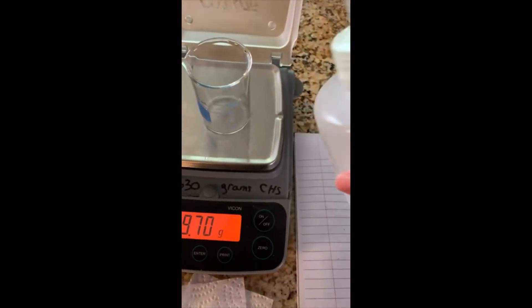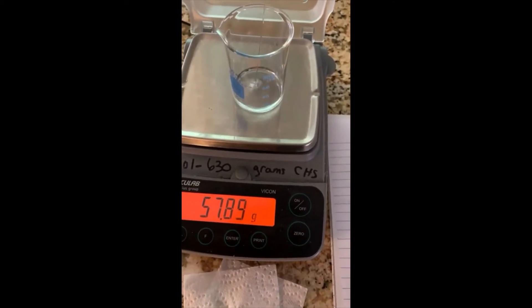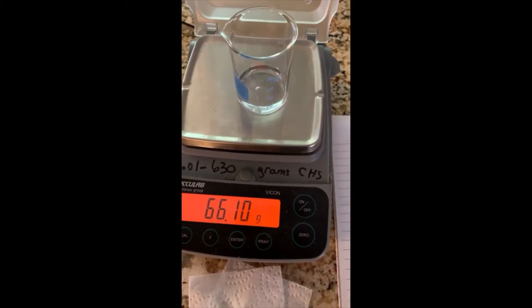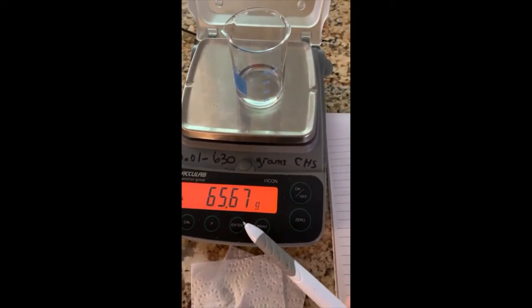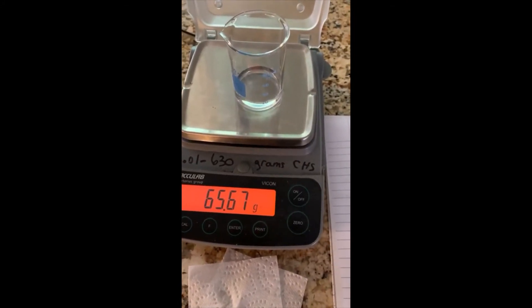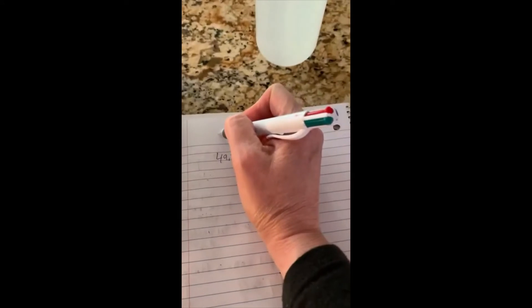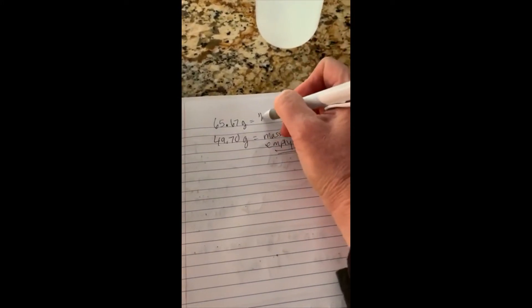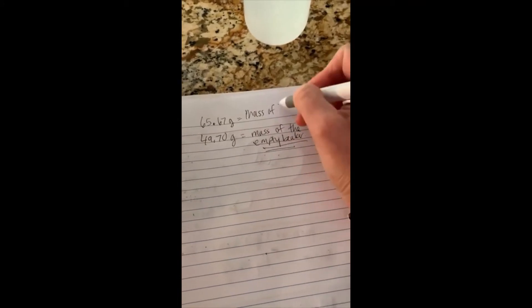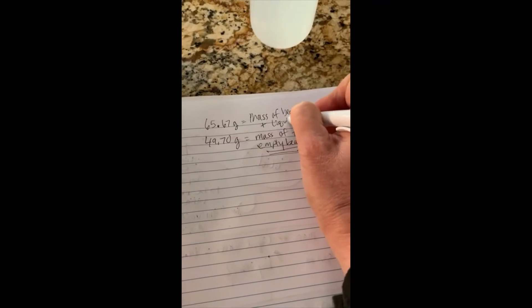Now we're going to add some liquid and watch the mass go up. I need to know how much is the mass of that liquid — not the mass of the beaker. Because this right here is the mass of the beaker plus the liquid inside of it. So let's write that down: 65.67 grams is my mass of beaker plus the liquid water.